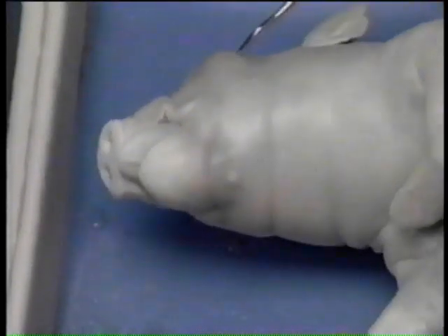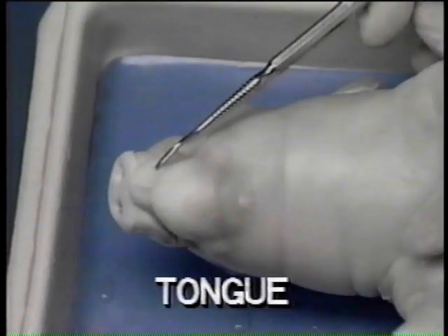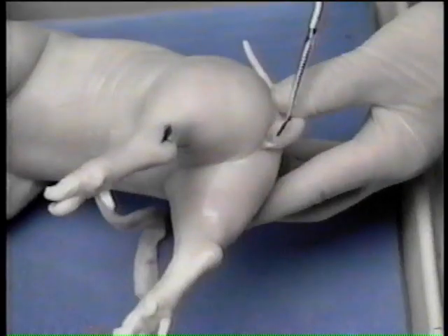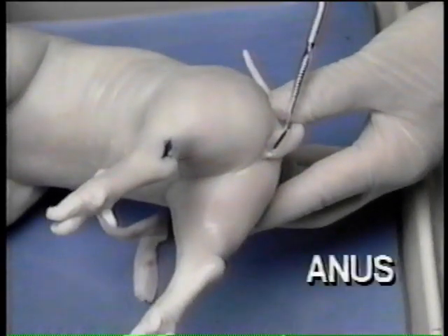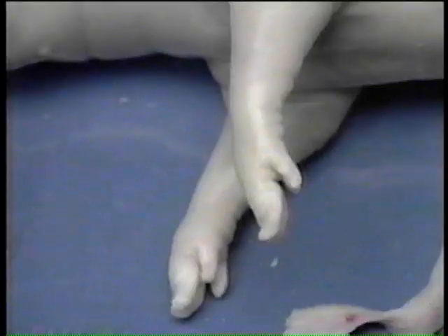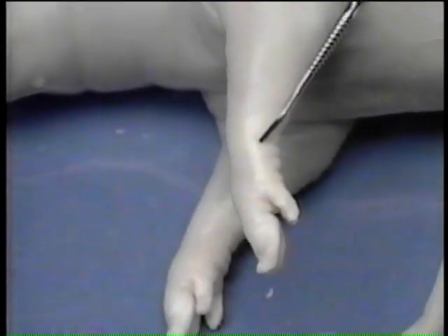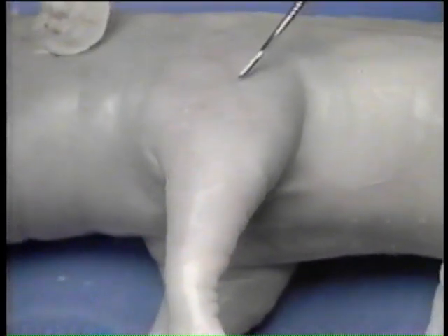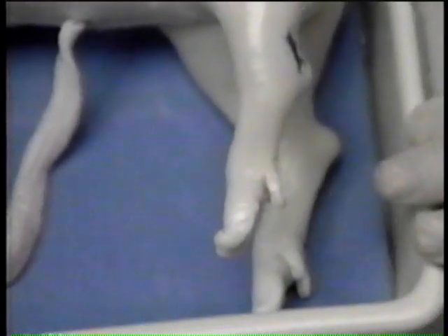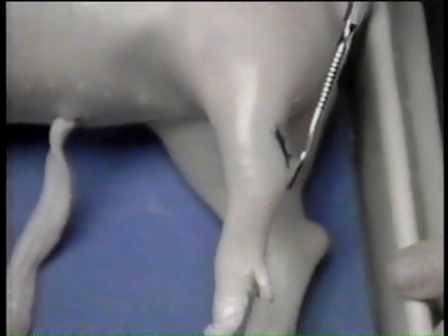and a relatively large mouth. The tongue is seen protruding from the mouth. The external nares, or nostrils, are located just dorsal to the mouth. The external opening for solid wastes, the anus, is located directly under the tail. In the forelimb, you can recognize the digits, the wrist, the elbow, and the shoulder. In the hind limb, the digits, the ankle, the knee, and hip.